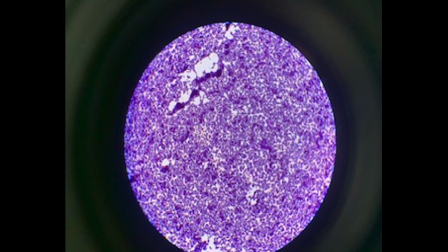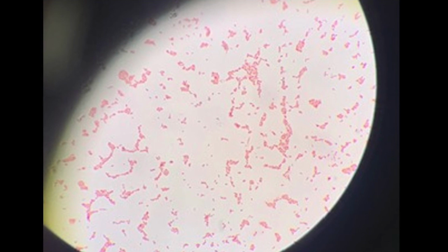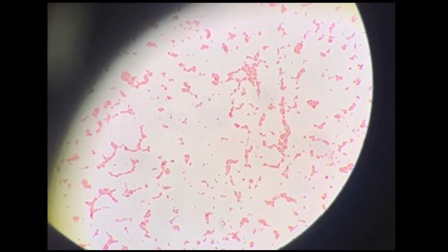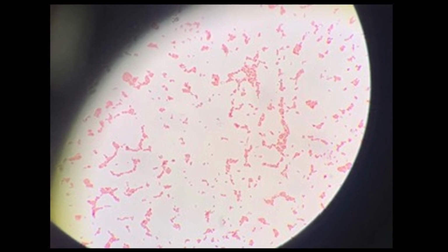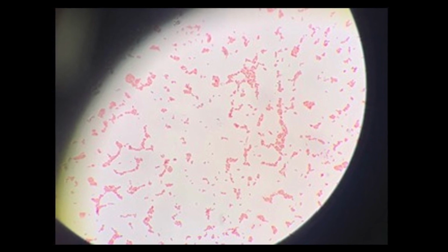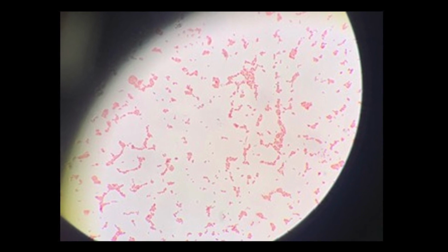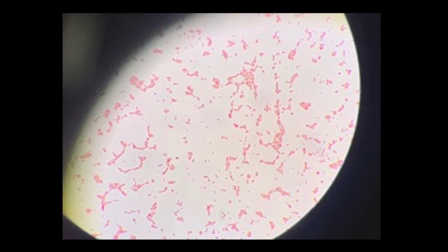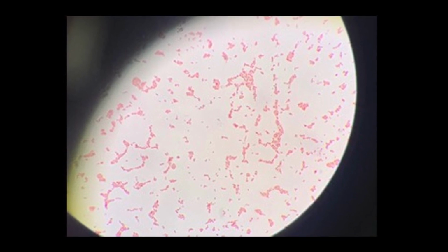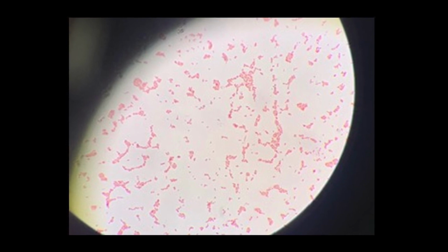Now we move on to our gram-negative smear, and this is the E. coli, which is our gram-negative rod. As you can see, there's a really big difference between the color. That gram-positive was a nice dark deep purple, and this one we have a red/pink color. Like I said, the safranin dye itself is red, but under the microscope it looks pink. But that big main difference between the purple and pink, that's what you want to see. If you were doing an unknown and you saw this color, then that would mean that that is a gram-negative cell. If you saw the purple color, then that would be a gram-positive cell.